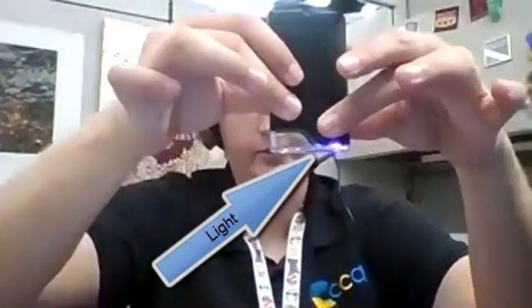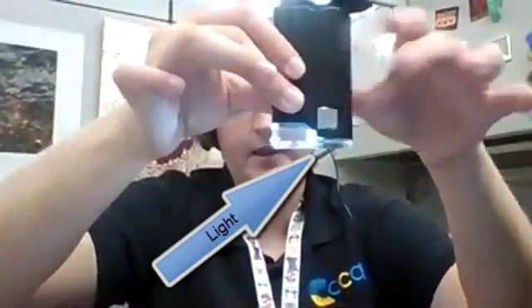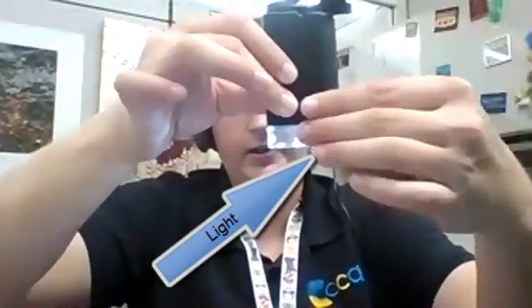And this adjusts the actual focus on this bottom knob, and down at the bottom here, there is a light, there's a UV light you can turn on, and then there's a regular bright light that you can turn on. And it just runs on two AAA batteries.